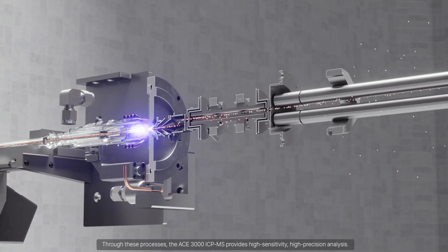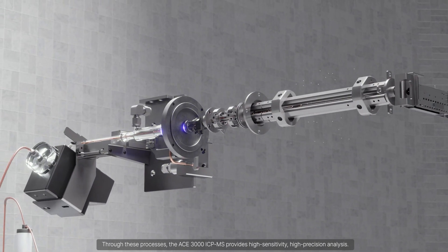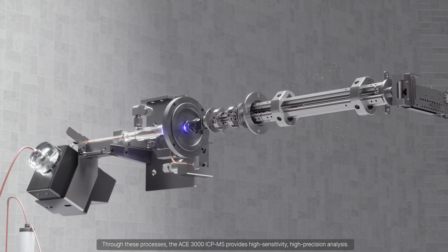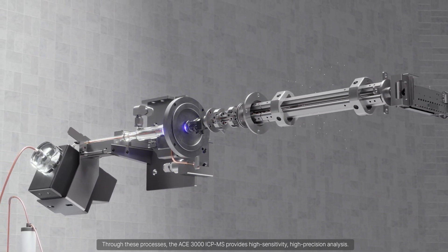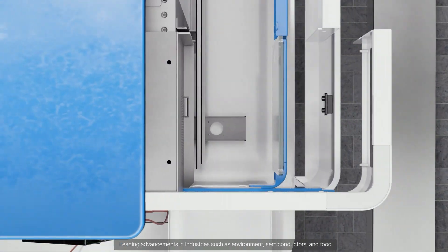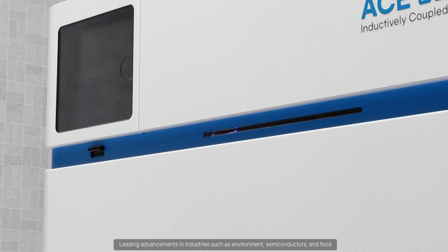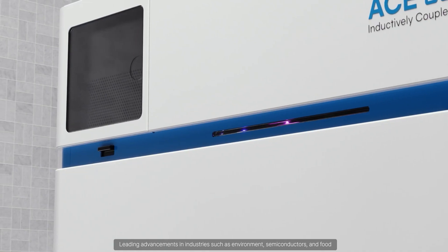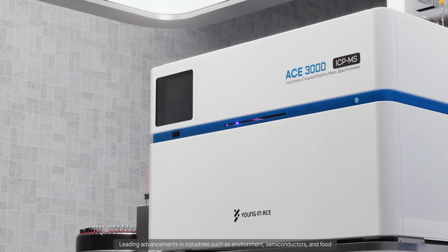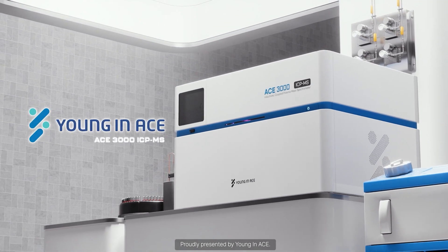Through these processes, the ACE 3000 ICP-MS provides high-sensitivity, high-precision analysis, leading advancements in industries such as environment, semiconductors, and food. Proudly presented by Youngin ACE.